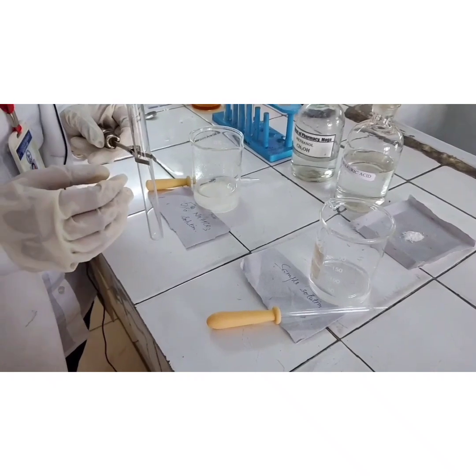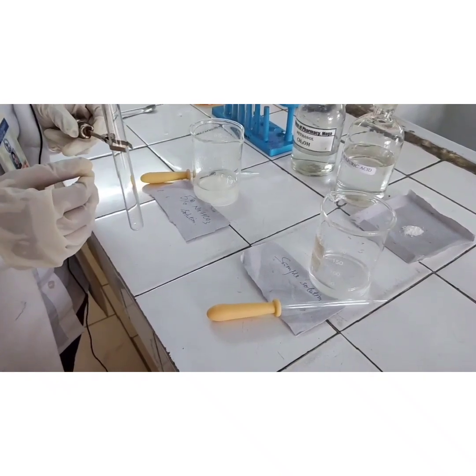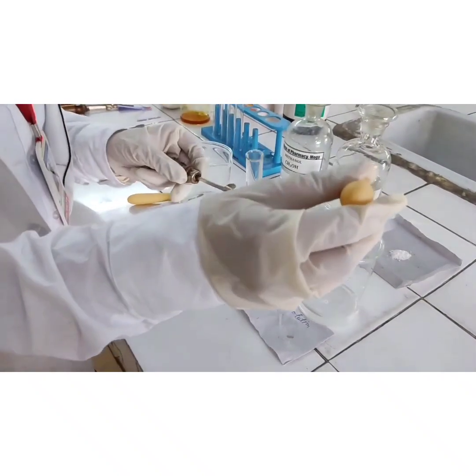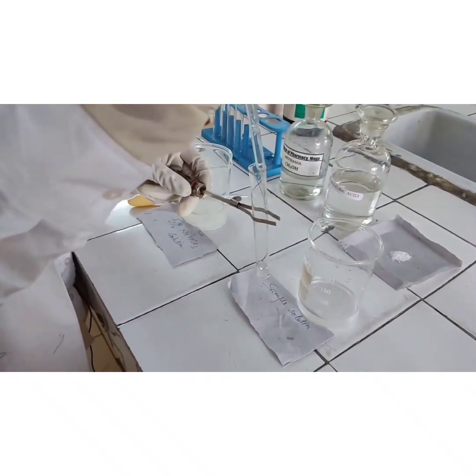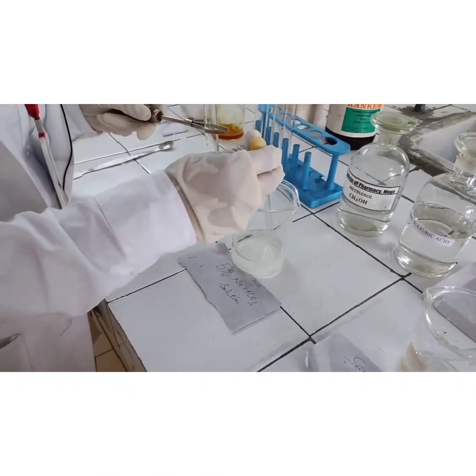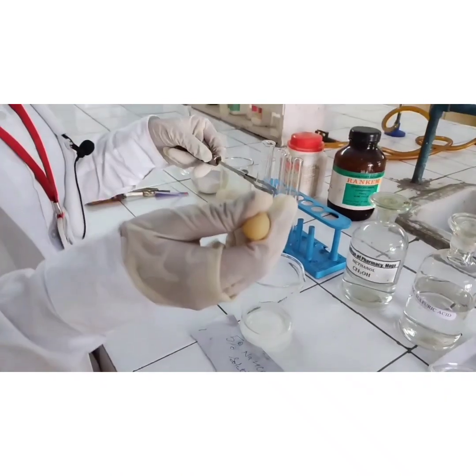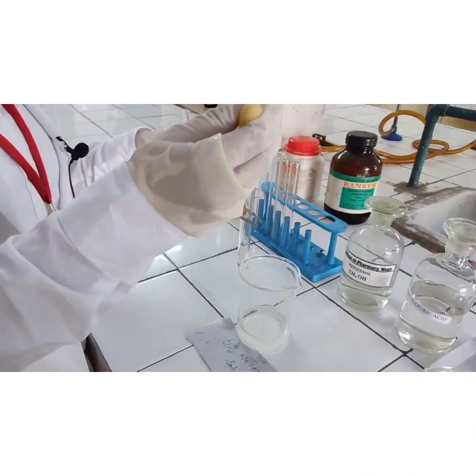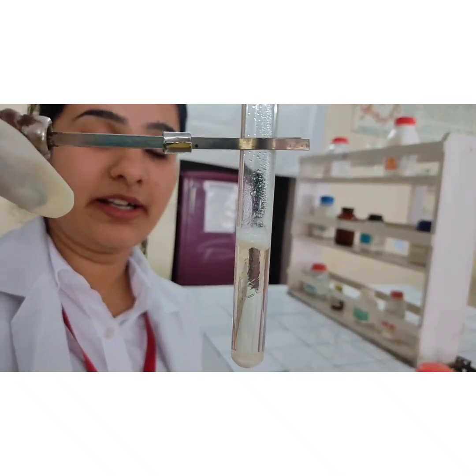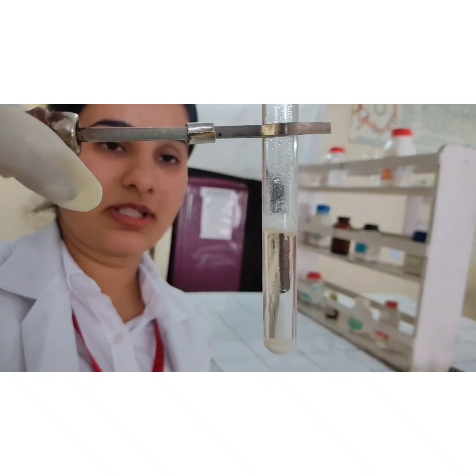To distinguish whether our compound contains a carboxylic acid group or a phenolic group, we will perform a test with sodium bicarbonate solution. We take the sample solution in a test tube and add 5% sodium bicarbonate. There is evolution of carbon dioxide gas, which clearly indicates that our unknown compound contains a carboxylic acid functional group.